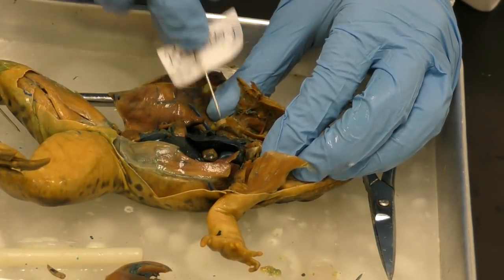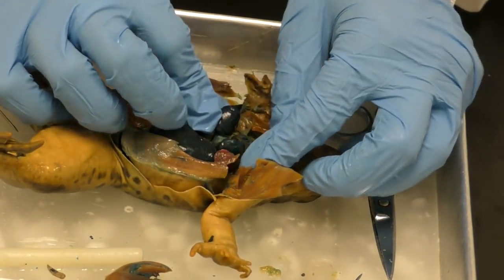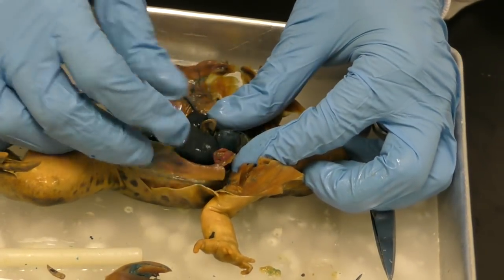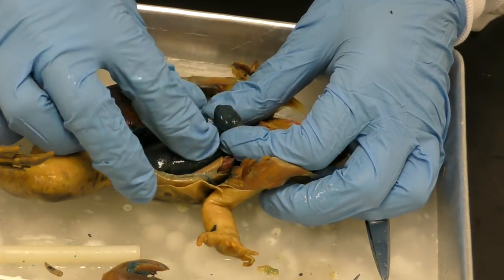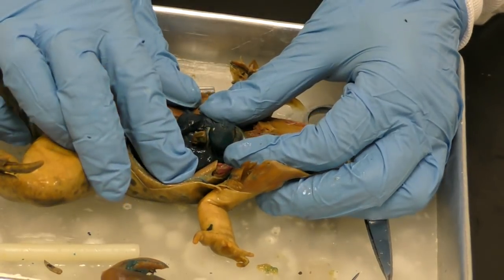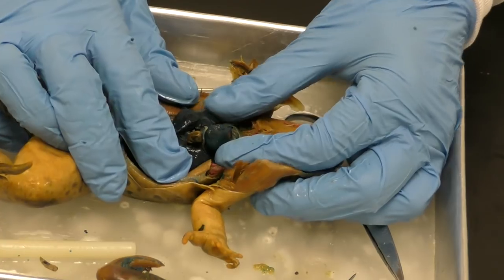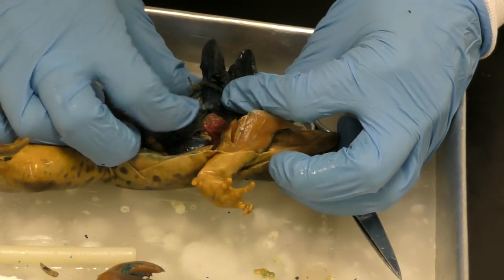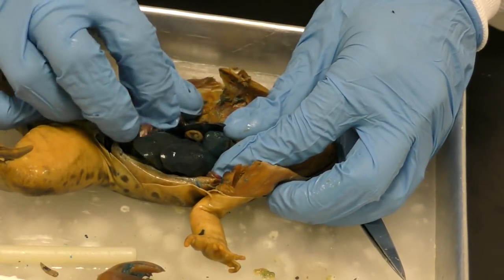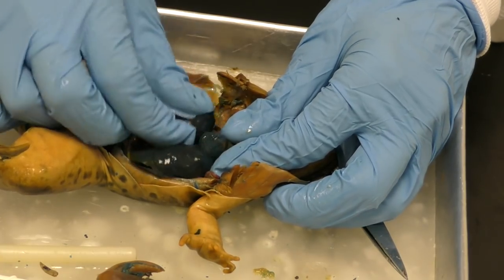All right. Now, the last thing to get is often very petite, but not this one. This one is actually in good shape. Okay. So this organ is usually harder to come by. Let me just double check something real quick. It's usually nestled here in the liver. So they have 3 lobes of liver.